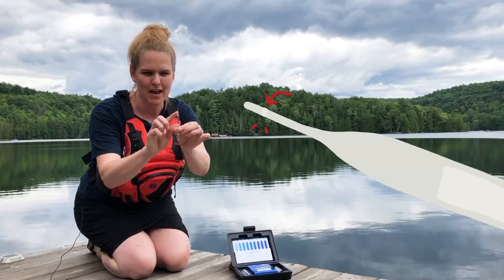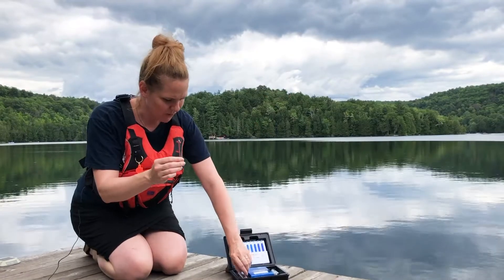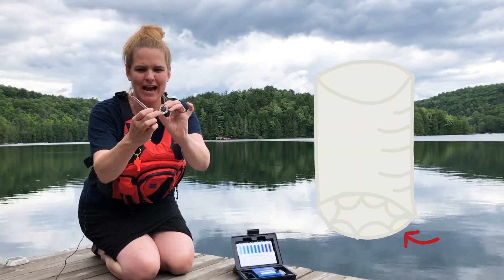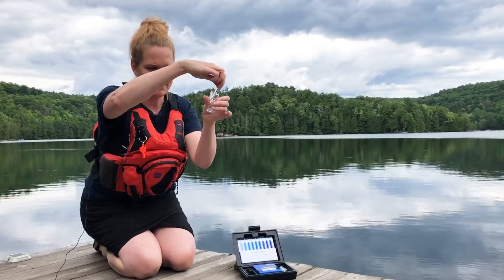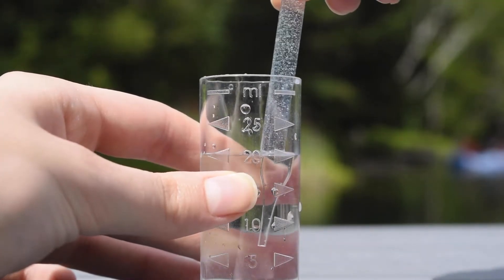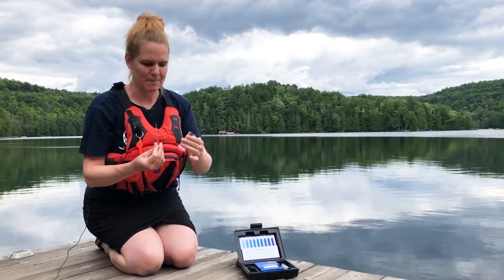To do this test, we're going to take an ampoule out of our container. What you'll notice is a white line — this is a weak point in the glass. We also include this sample cup, and it's really important to have a look at the little ridges here. When I have my sample, I'll put the tip in one of those ridges and pull towards me.